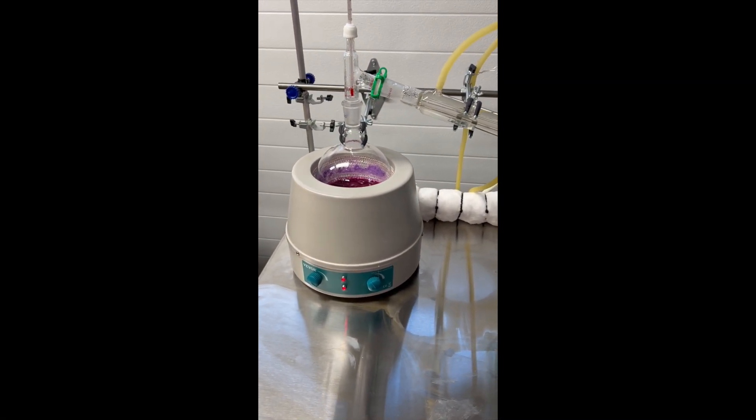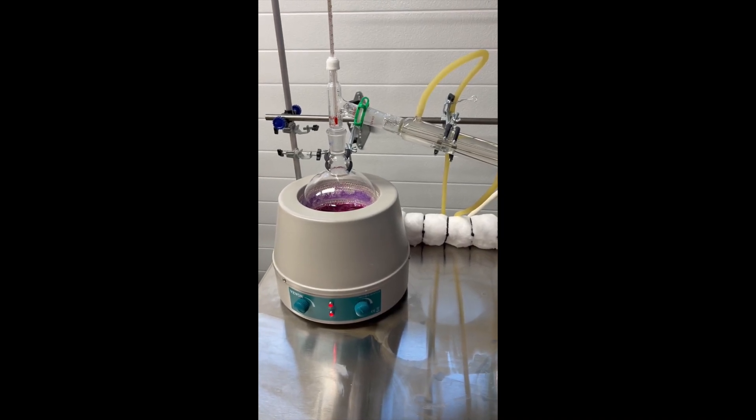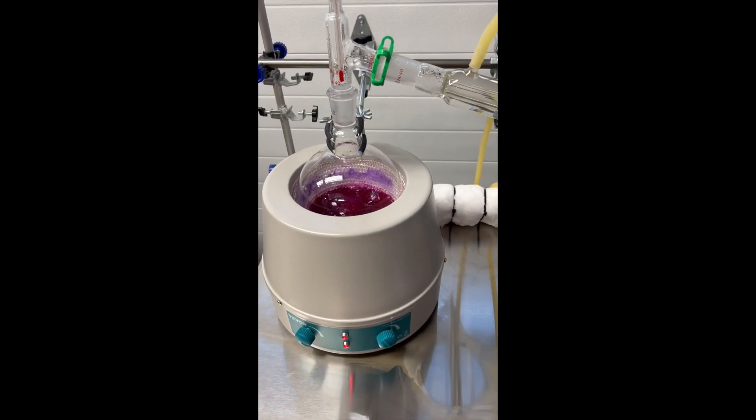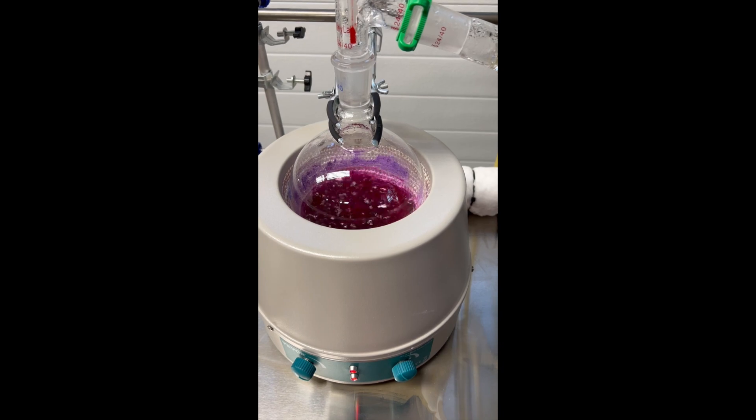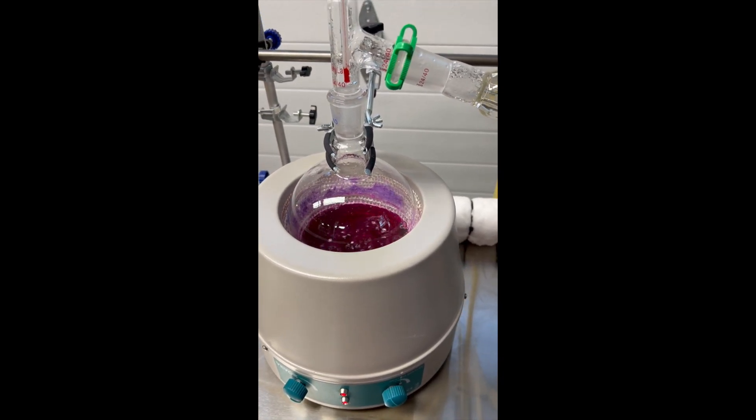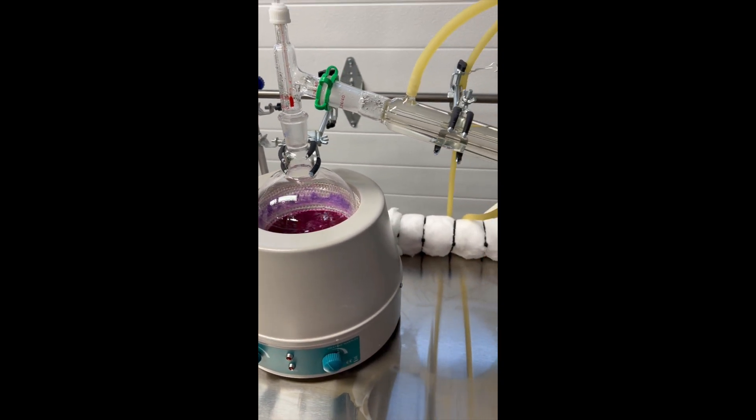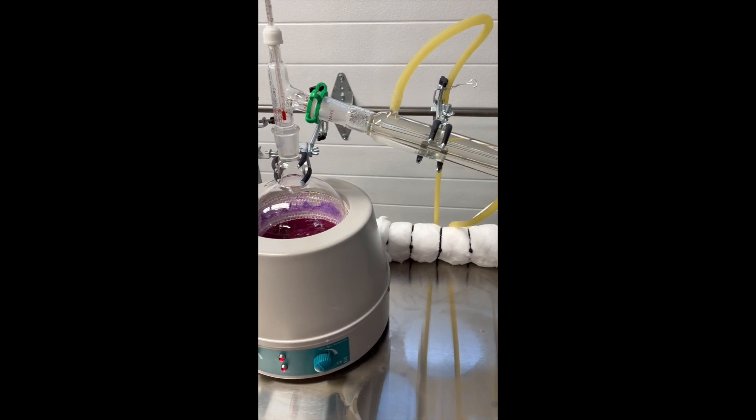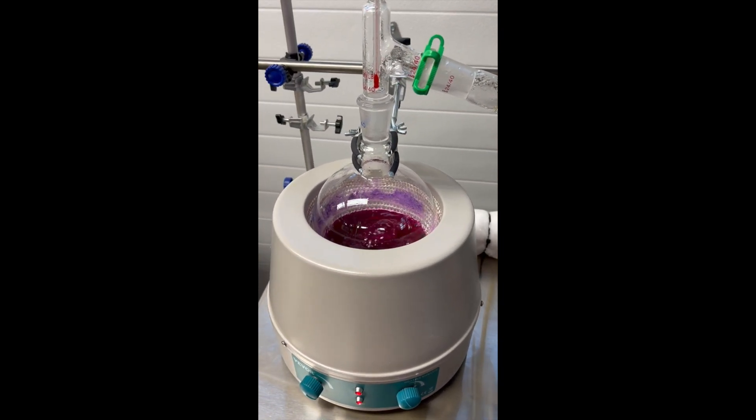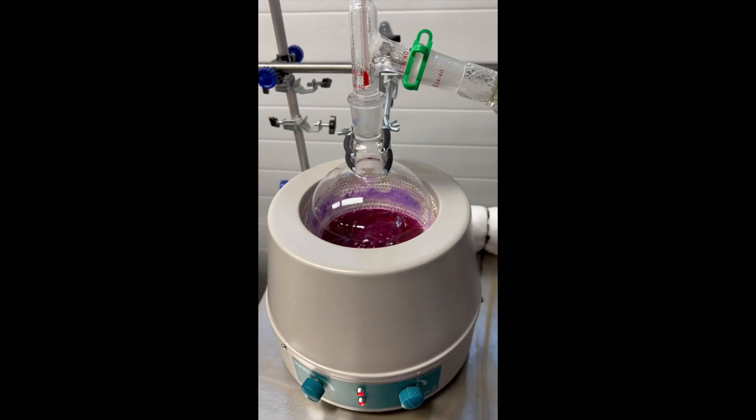Hey guys, it's Andy here. I just wanted to show you what I'm playing with in the lab today. Right now I'm distilling the first electrolyte from the first cell that finished up the 500 milliliter to 100 milliliter reduction. So it's a 5 to 1 reduction.